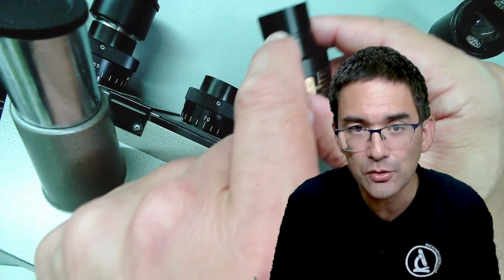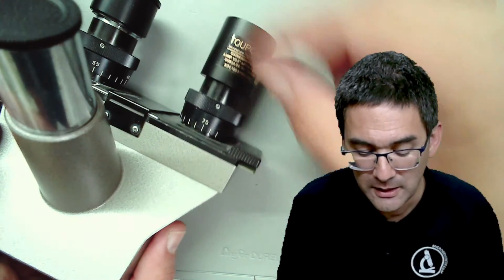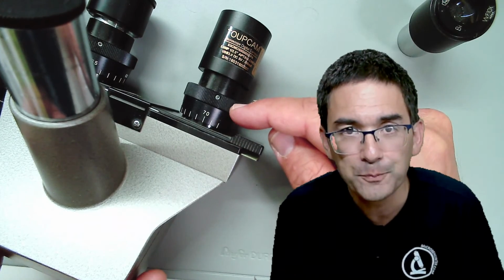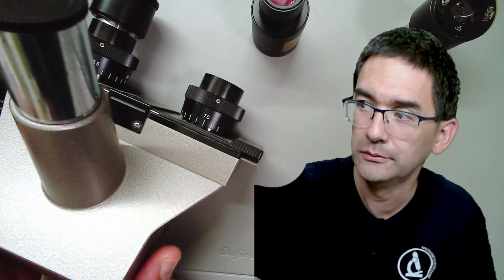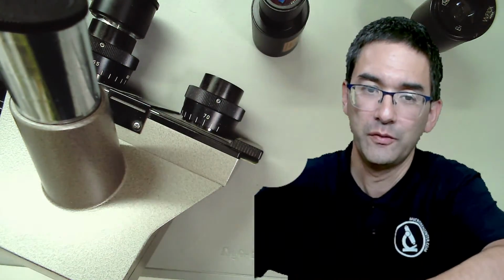This is the reason why the sensor is so far in front here, so that when you insert it, it is now exactly at the place where the objective makes an image. Now with those microscope cameras over here, let me detach it again. I could get it back, like the one over here.